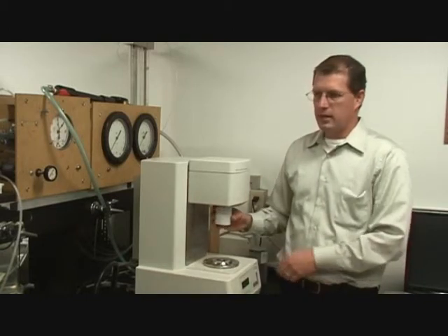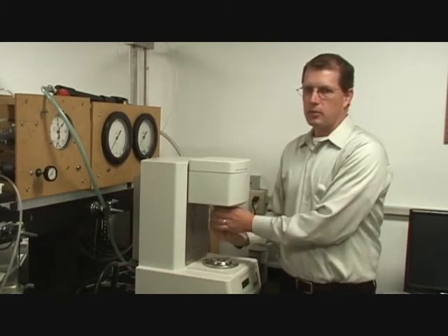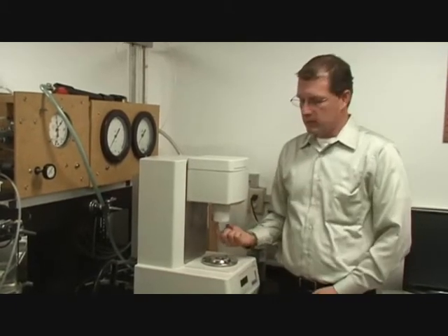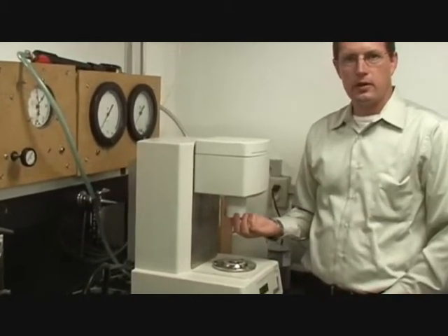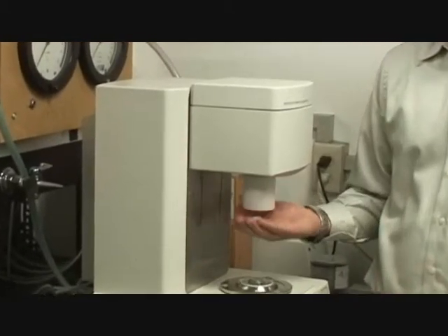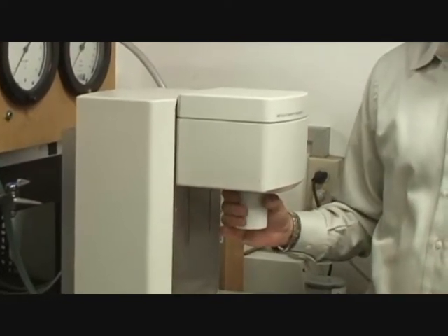The best way to take care of it is just to screw this little white piece into the thread. The nice part is that it doesn't prevent access. Someone can stick their finger up in here and feel the air bearing and wiggle it. But for the most part, it makes access harder. As long as no one's going to touch it or move it, it's safe. It's not going to get damaged.